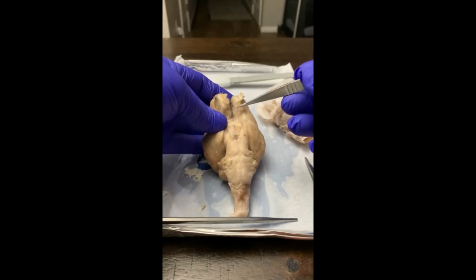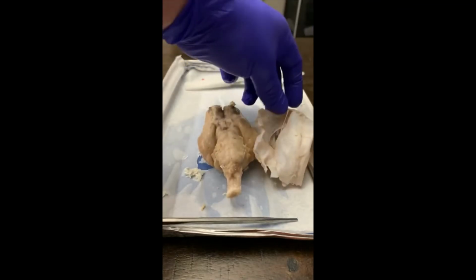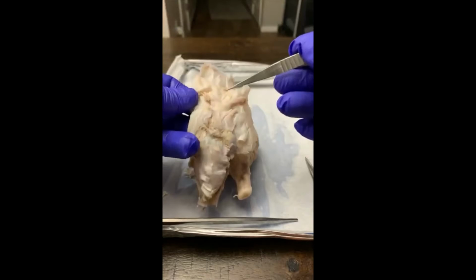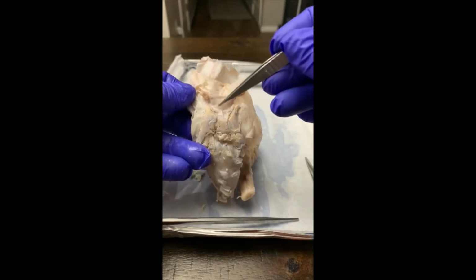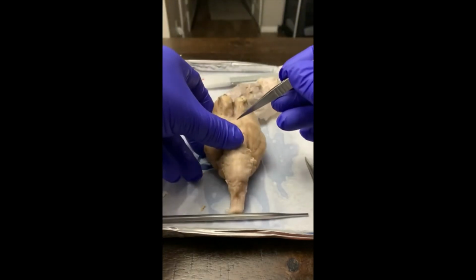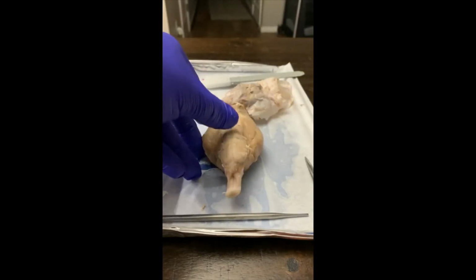Cranial nerve 2 is going to be the optic nerve, so let's pull this out here. So here you have the optic nerve. This is going to go to the orbits. The optic chiasm, which is right here, they cross over. And then down in here where I dissected is going to be the optic tract.